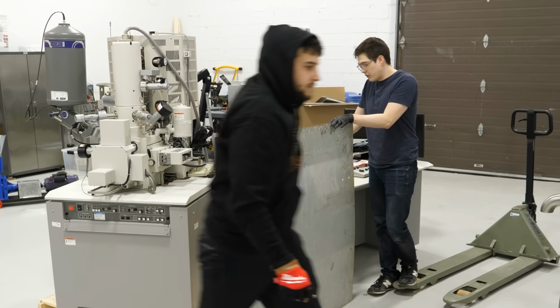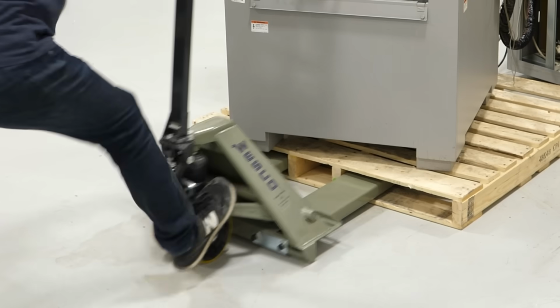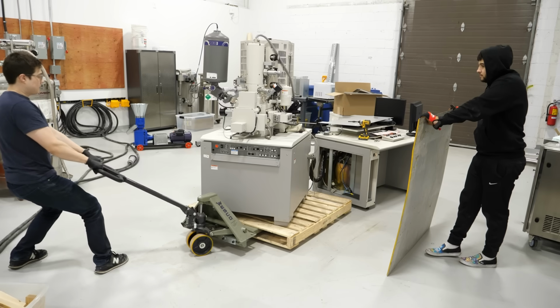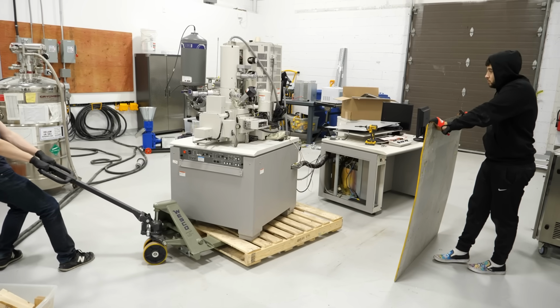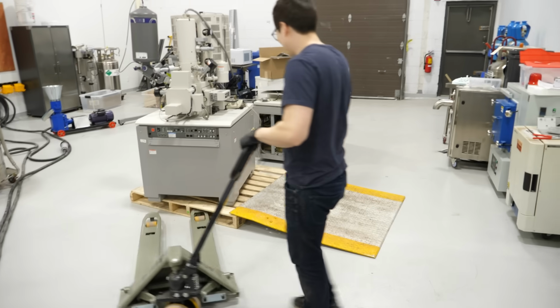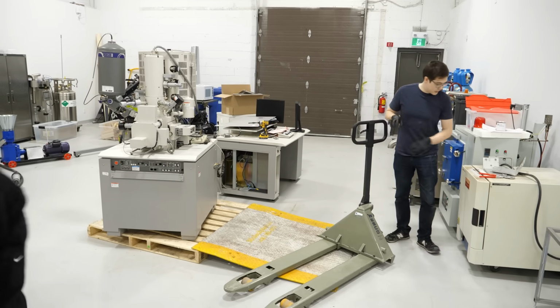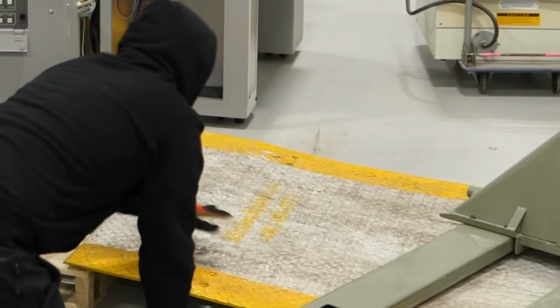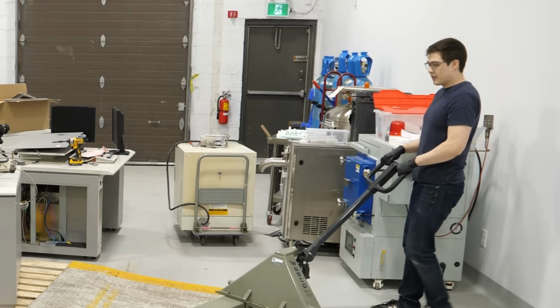Zach was saying something about moving it. Yeah, so we have... I'm not readjusting it. I'm telling you that much. Yeah, and then there's that. You have a little bit more room. It's better. So should we put wood under there or just go for it? Probably. Yeah. We gotta move this oven. Let's go. Time to lose all of our money.